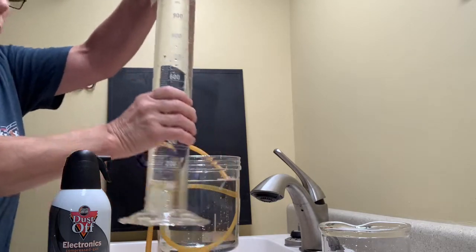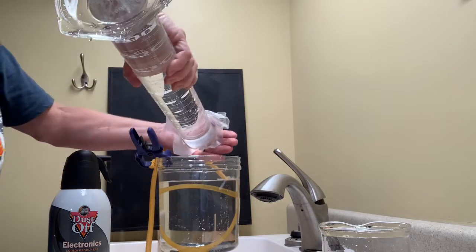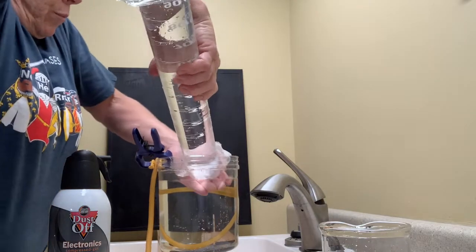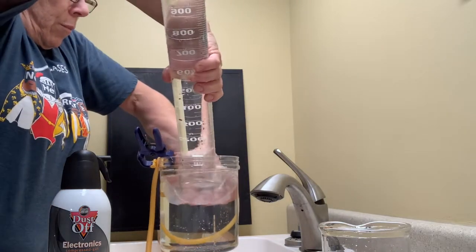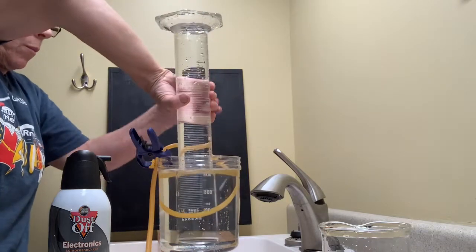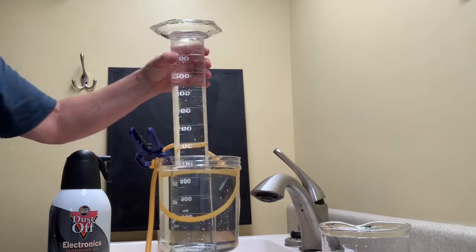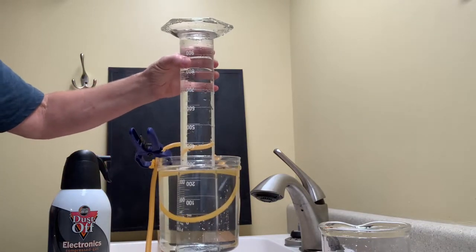Alright, looks like that went okay. Maybe a bubble or two. There's one bubble or two. There's another little one. So we'll certainly have a small amount of air due to those bubbles.